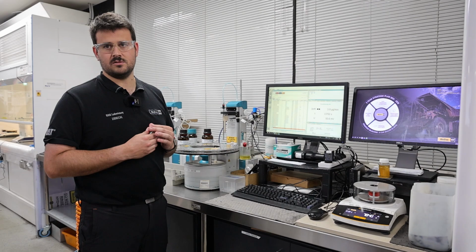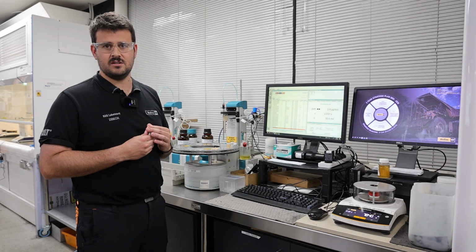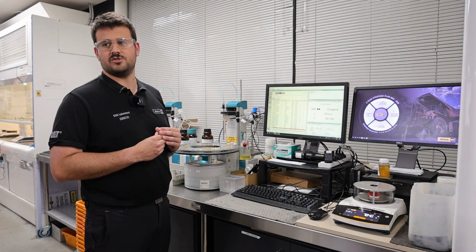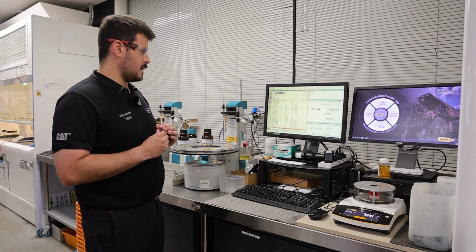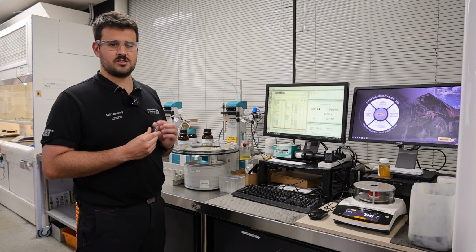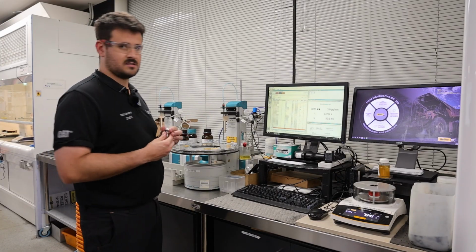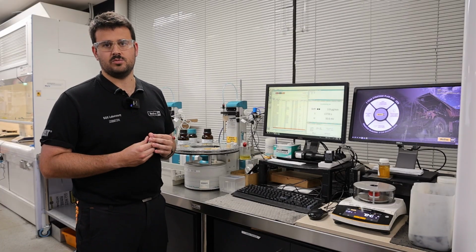Inside that reaction vessel is a special solution that reacts with the water in what's called a redox reaction, which produces an electrical current. That electrical current then in turn produces a voltage, and this system's able to calculate that and pick up on it. Based on the amount of voltage that reaction creates, it's then able to back calculate how much water reacted with that solution and compare it to the starting weight of your oil to figure out the percentage water content of your oil.